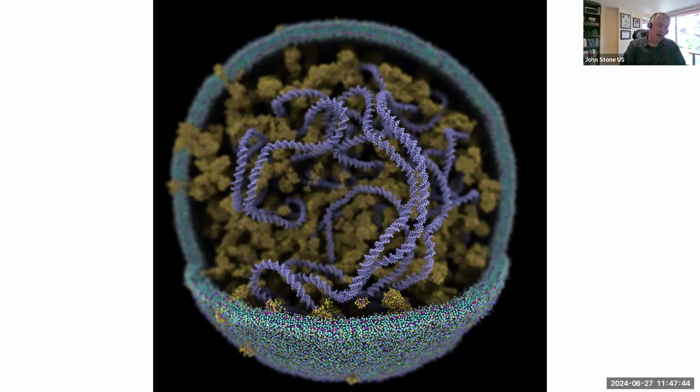Over the past year, I had some patches that I had been testing for a long time, like the stuff I showed earlier in the talk where I made the cell model load 6 times faster. Some of the stuff I did for atom selections, I wanted to exercise for a long time before I put it in the standard version. But all those things are in there now. Every bug fix, everything that ever broke up to 1 billion atoms is in the current version of the code now. So it's pretty awesome. The hard limit right now would be somewhere around 2 billion atoms, if they're not a duplicated structure.